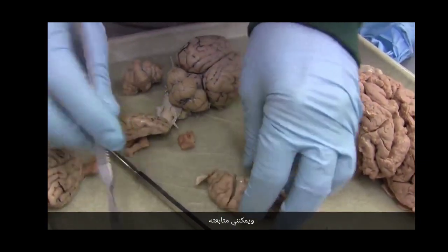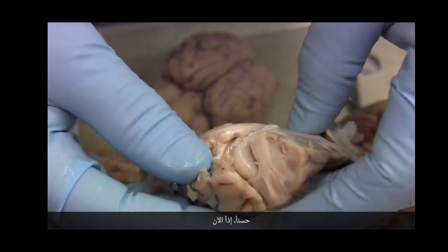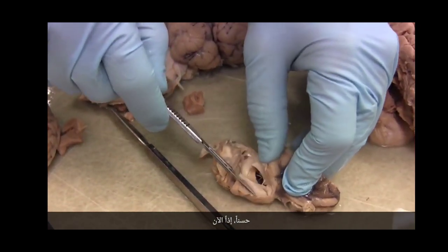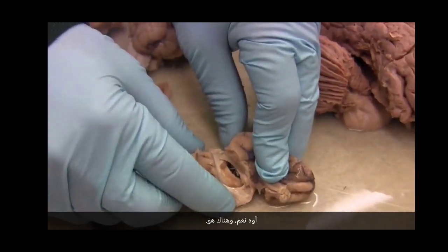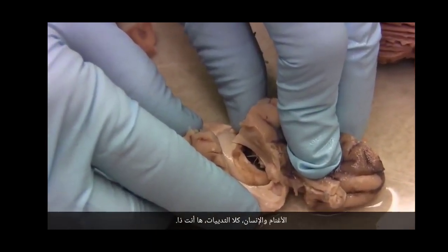Can we show it again? A little more slow. Yeah, there we go. Okay, so now we're gonna go like that. Oh, look at that, it's so pretty. Oh, yes, and there it is. Sheep and human, both mammals. There you go.